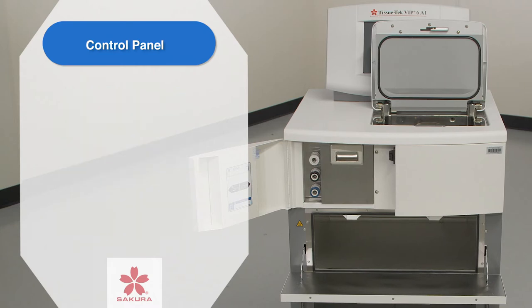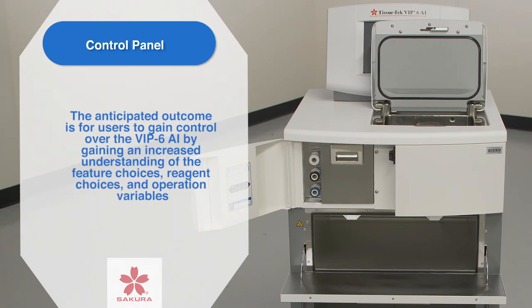The anticipated outcome is for the user to gain control over the VIP 6AI by gaining an increased understanding of the features and operation variables.